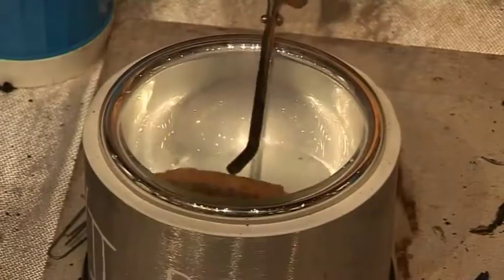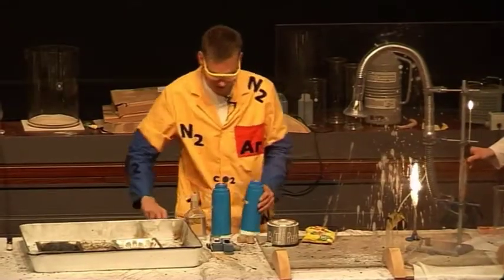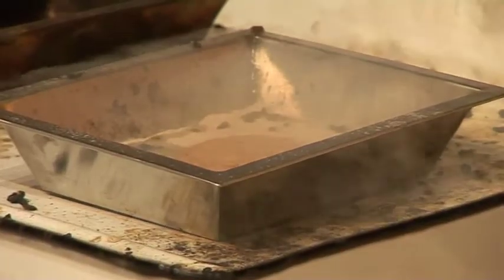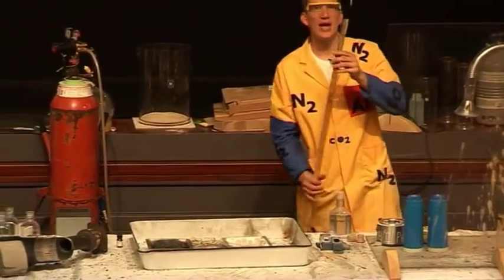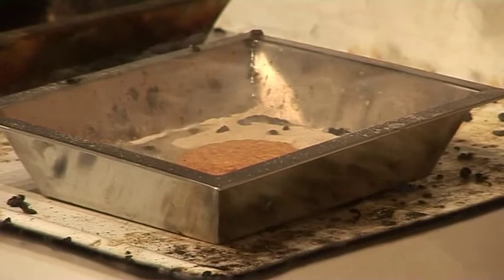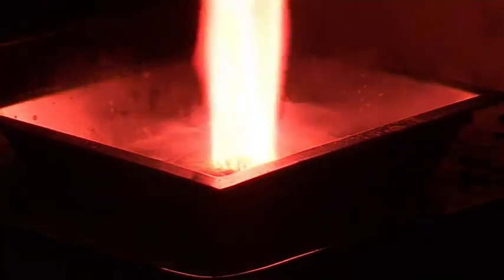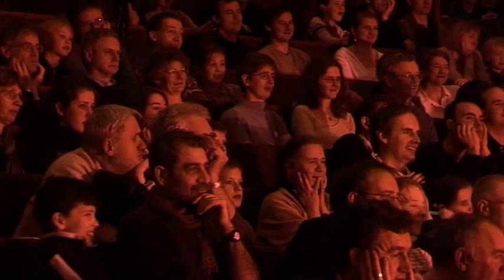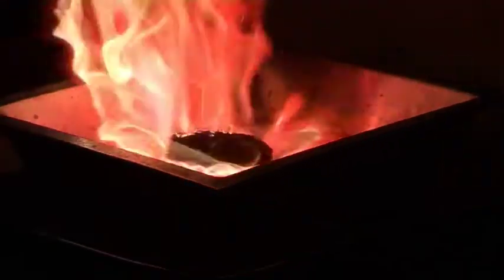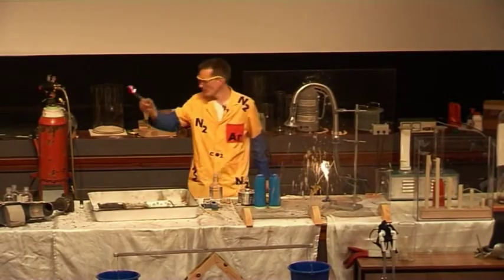Get my biscuit out if I can — this is always the tricky bit. There we are, that's the biscuit out. Add a little bit more oxygen just to be on the safe side. Then apply a light and you may be able to detect the energy coming out of this. Now watch carefully. So I hope you noticed there the energy being released from the hobnob as it combined with the oxygen.